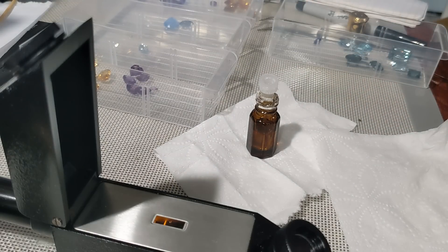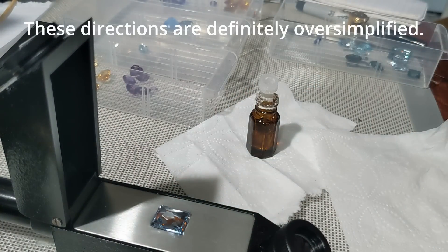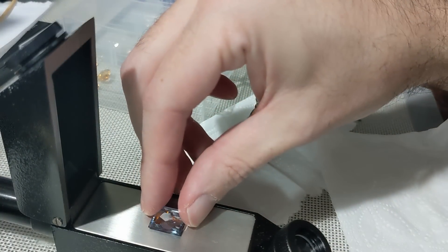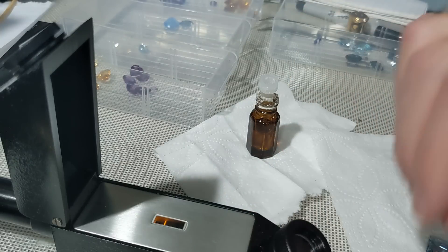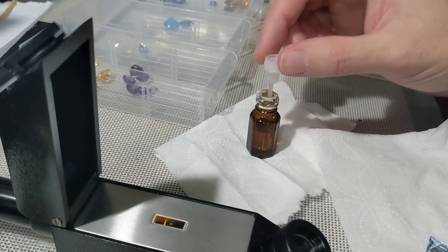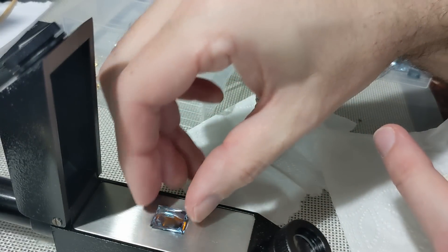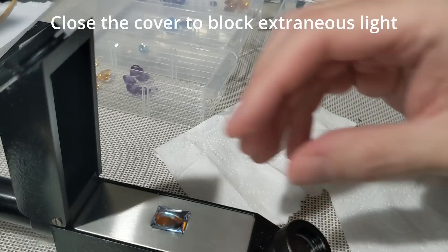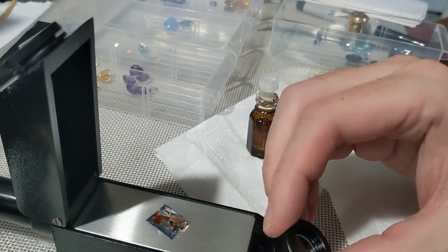But the refractometer is a quick and easy way to narrow down on gemstone species. Starting with a clean faceted stone, put a drop of fluid down, then put the table side down on the glass and align the stone in the middle of the refractive window. The glass on this model is lead glass, which is softer than quartz even, so it's easily scratched if you're not careful. They do make some with CZ windows. Once you see the shadow on the instrument, rotate the stone, check the shadow again, use the polarizer if there's birefringence, and that's all there is to it. I was relatively quickly able to separate out the amethyst from the sapphire and many other stones without much experience.